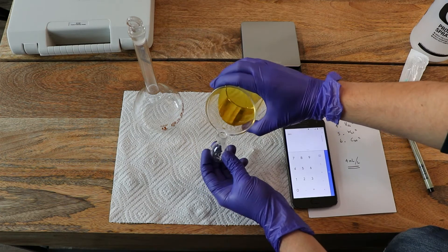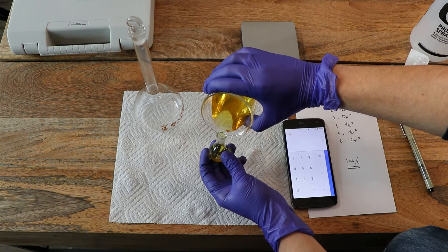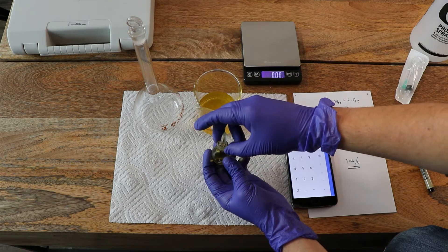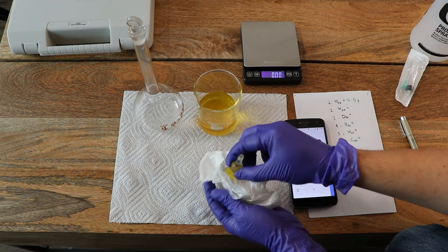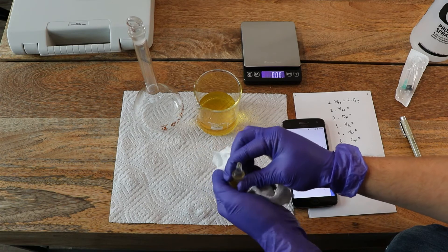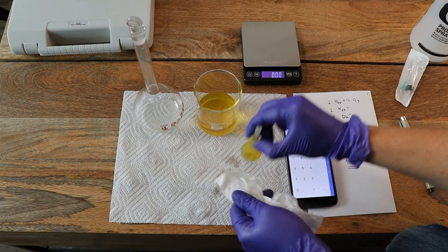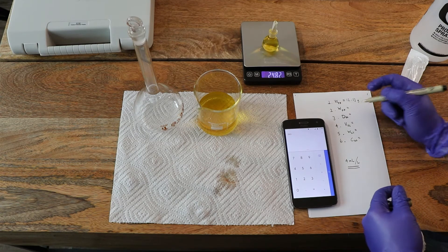In order to use this, you actually fill it all the way to the brim. See, I'm filling it all the way up to the brim, and then I put the stopper in and it will overflow, which is totally normal. Now I'm going to just take a paper towel and ensure that the pycnometer is dry. Having it overflow is very important for the measurement — you fill it to the brim, allow it to overflow, and then weigh it after you dry it.